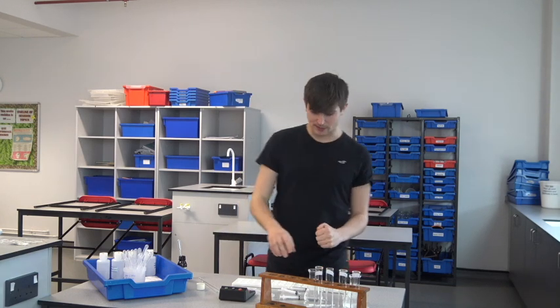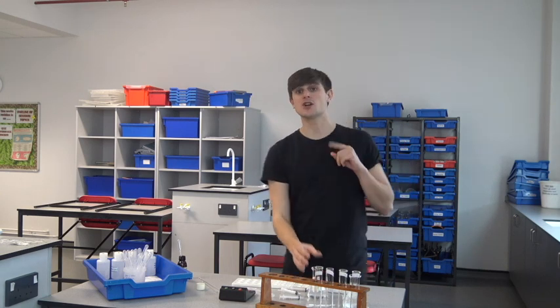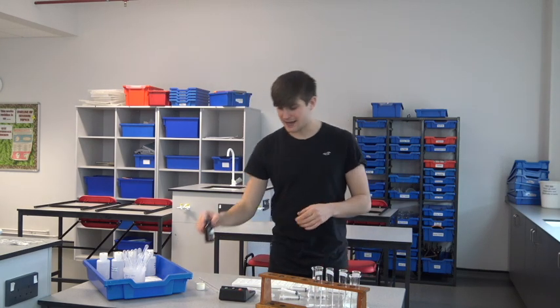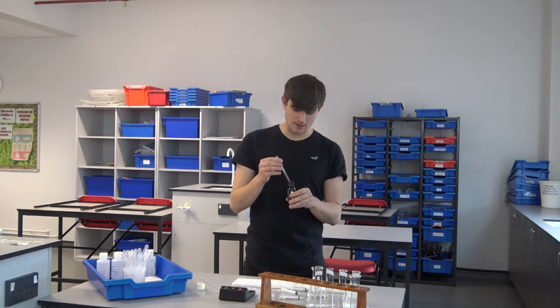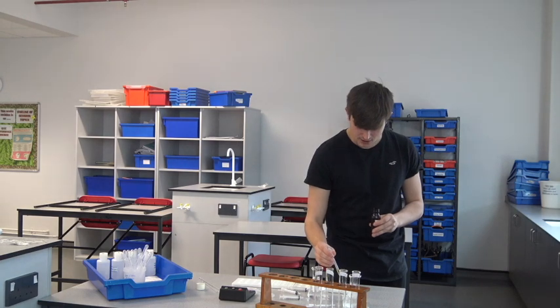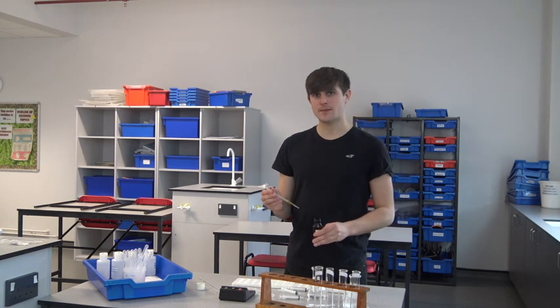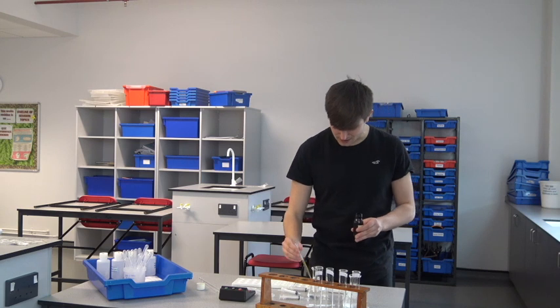The way we're going to do that is because when amylase and starch are put together, that makes glucose. I can test for the starch using iodine. We're going to put a spot of iodine in each spotting tile. If starch is present, the iodine should turn black. Once the enzyme has broken down the starch, we should see the iodine staying that same orangey colour.